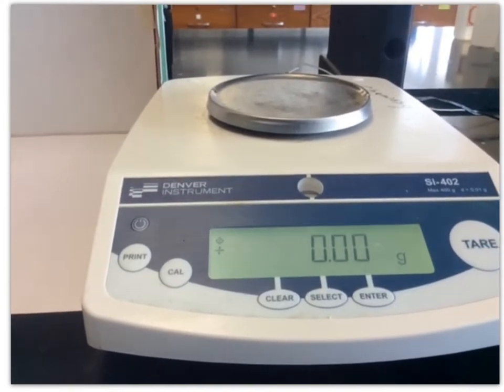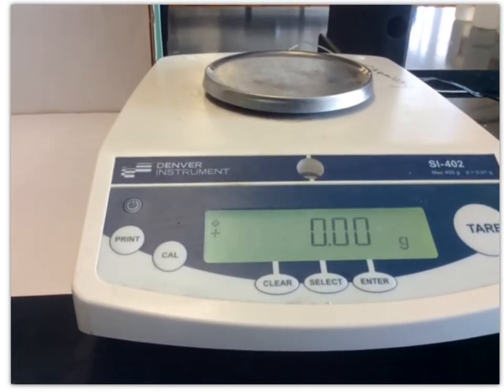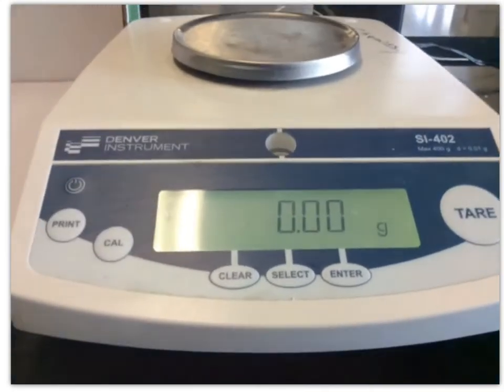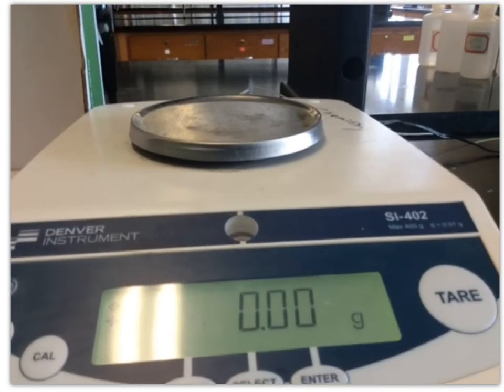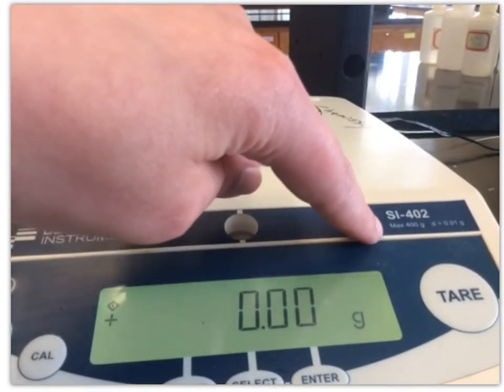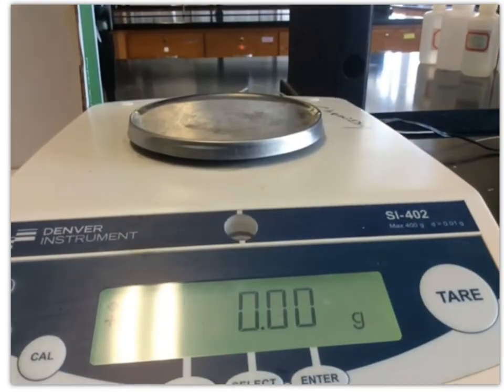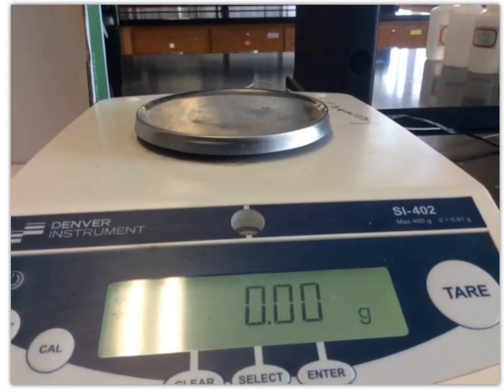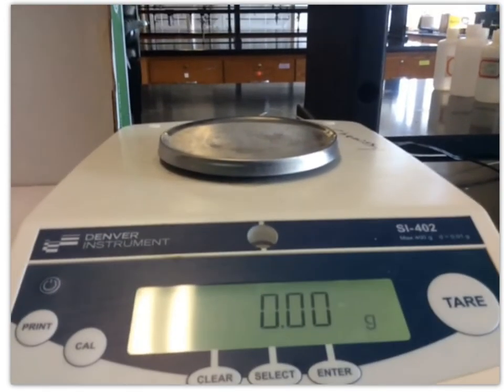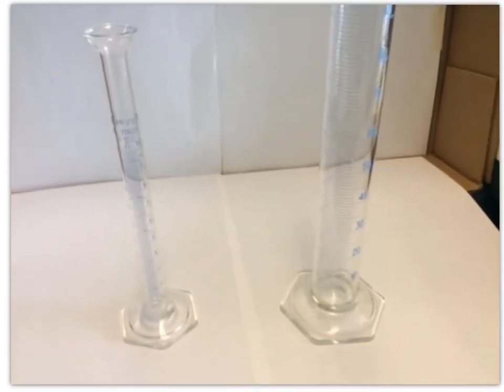Okay, so that second decimal place is actually not exact. If I picked up this balance and looked on the back or the bottom, somewhere it tells us exactly what the error is. Or actually it's right here. Usually it's hidden, but here we go. So it says this balance maxes out at 400 grams and the deviation is 0.01 grams. And so that's the error. That last digit, when it gives us, say, a 1 at the end, then it actually could be a 1, could be a 0, could be a 2. And so that's the error, or the possible deviation, in those measurements.